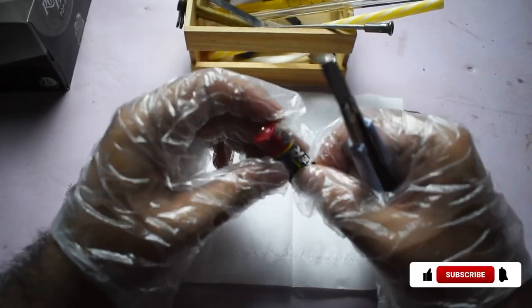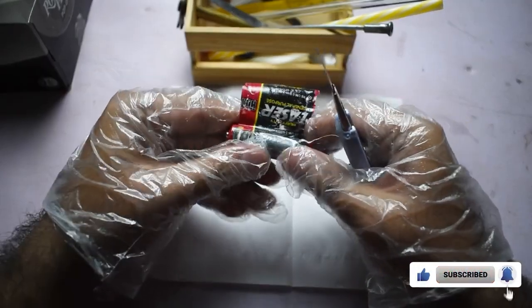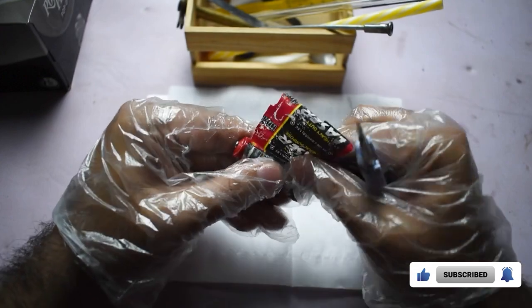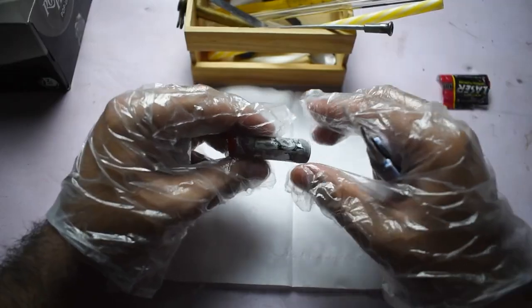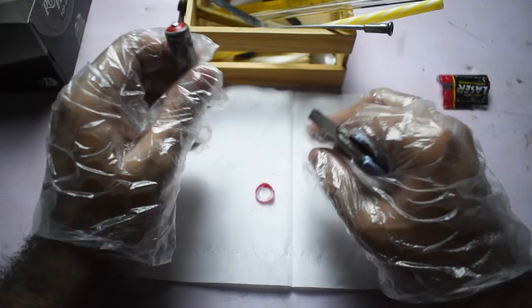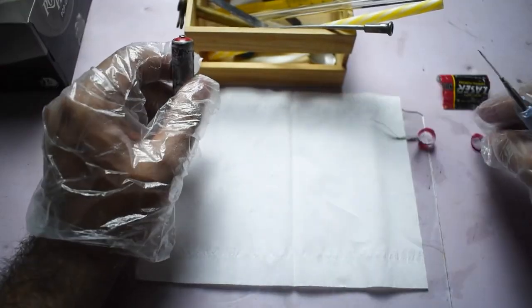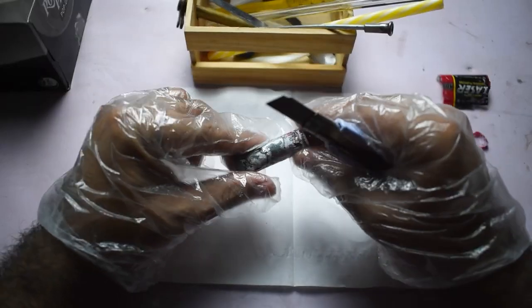For this demonstration, we'll use a common zinc-carbon battery. This particular cell has already been used in a wall clock. The outer grayish-silver casing of the battery is made of zinc metal. Zinc is a D-block element that typically loses 2 electrons when forming compounds. Inside the cell, zinc serves as the anode, meaning it undergoes oxidation by releasing electrons.